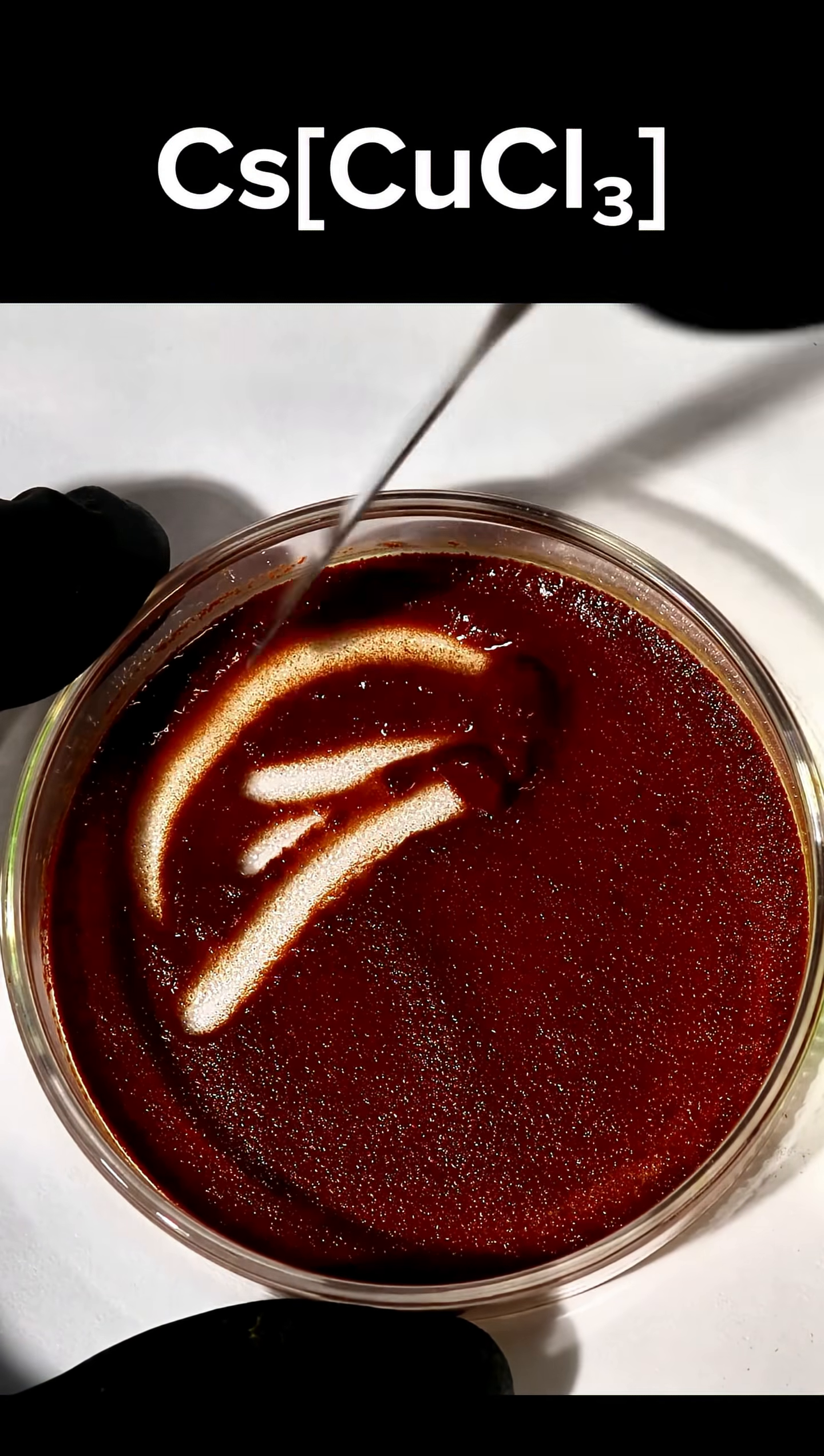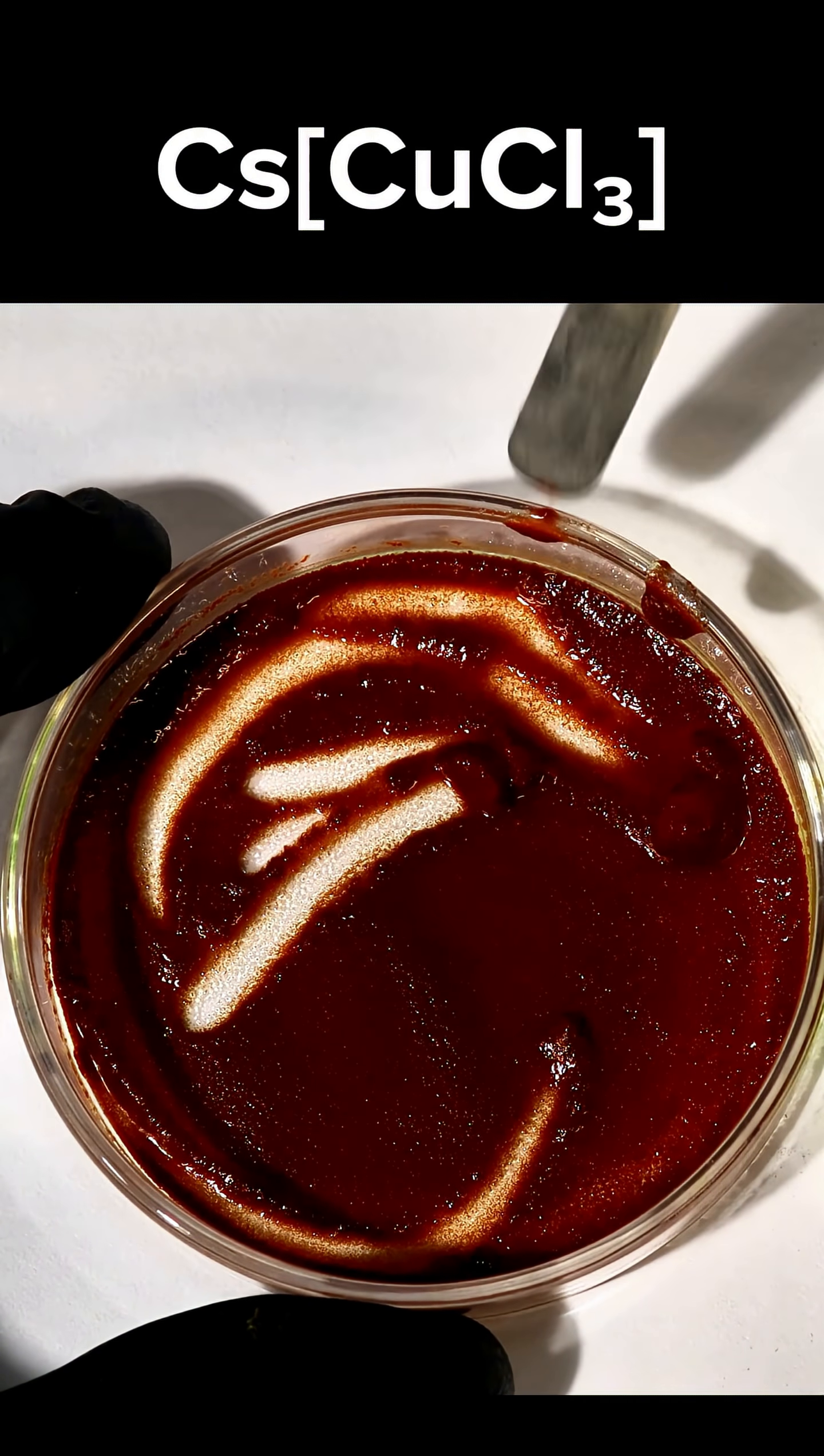However, even using cesium, this compound will dissolve in excess water, turning from a red solid into a light blue liquid.